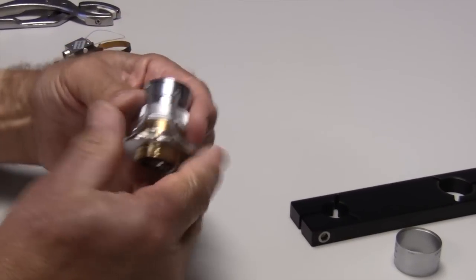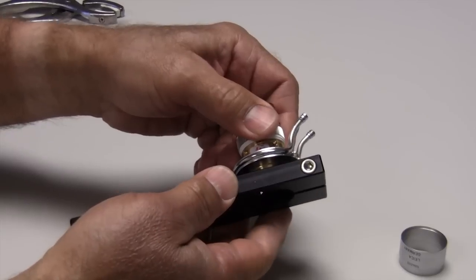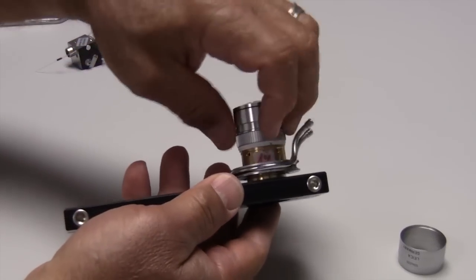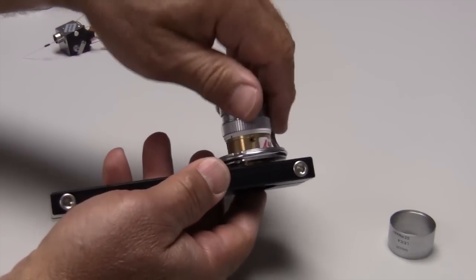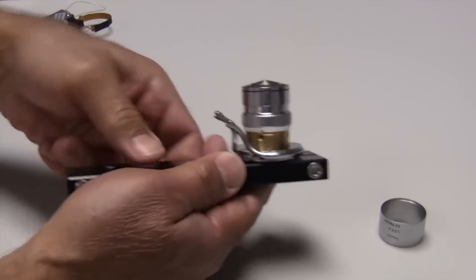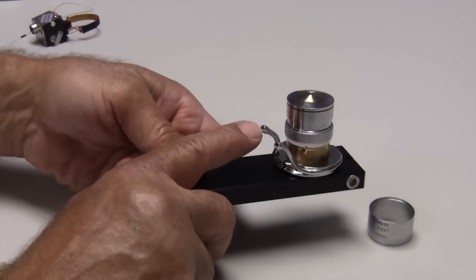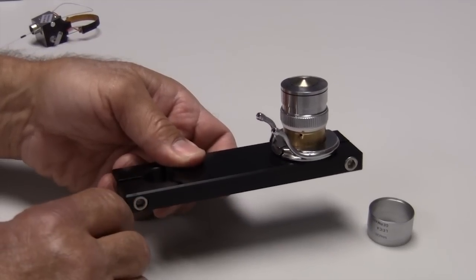Now this is ready to be screwed into the nose piece of your microscope. So we're going to assume this little wrench is the nose piece. And once this is in place, you would attach your tubing to the inlet port and the outlet port over to a refrigerant source.